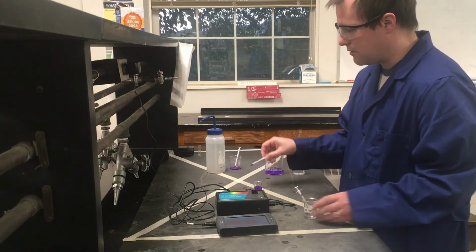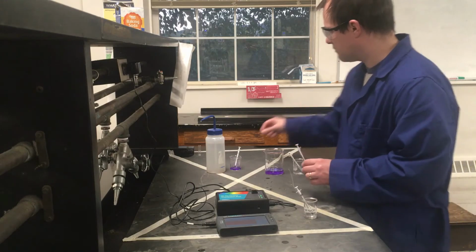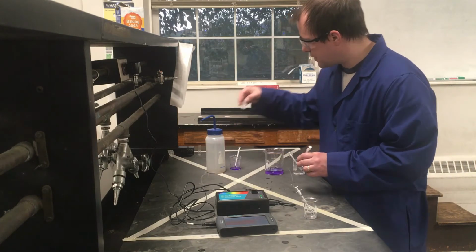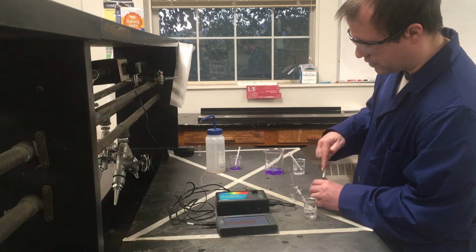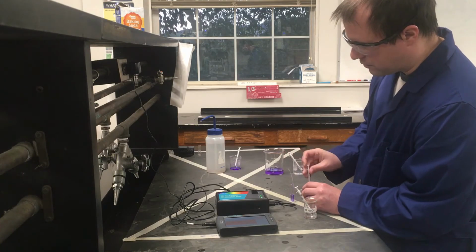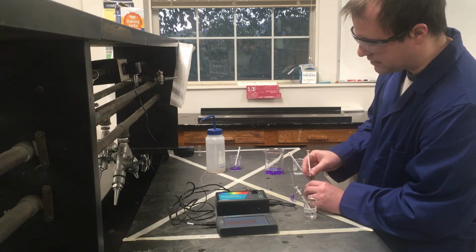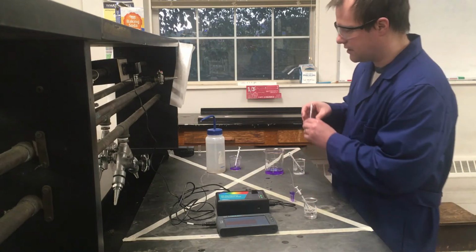And at this point, I can mix this a little bit just to get it started. I'm going to take my cuvette that I intended to use for my reaction here, and put some of this into the cuvette so we can measure this in real time. And ideally, we get the early part of this reaction where we can see it really well. It doesn't really make that big of a difference how long it takes to get this in there.